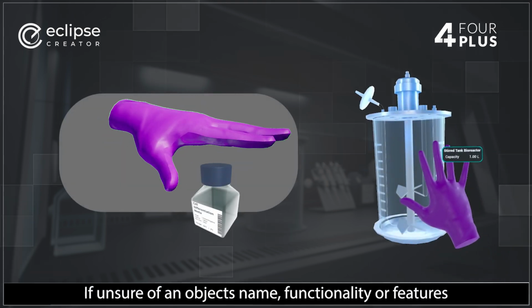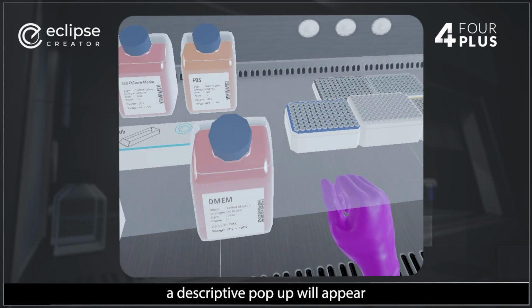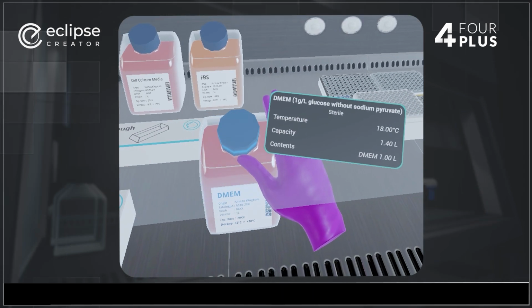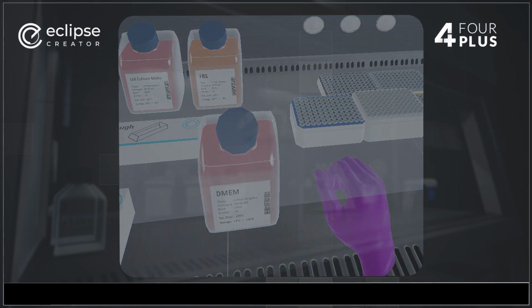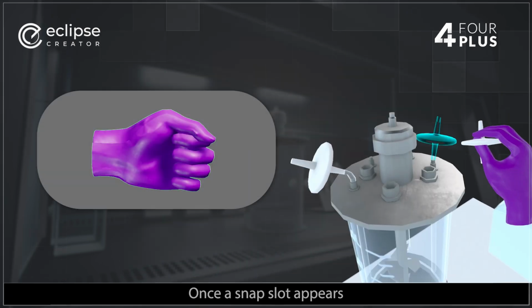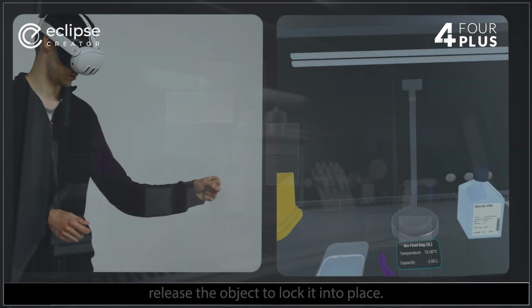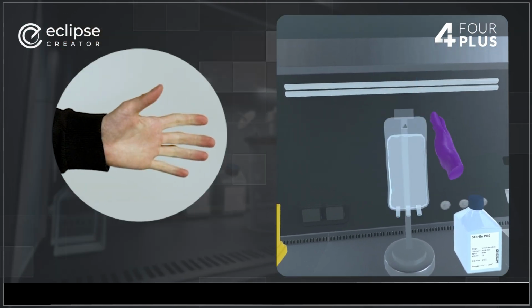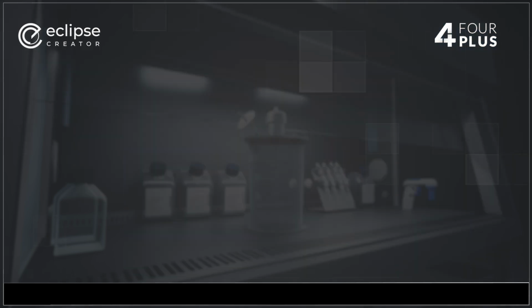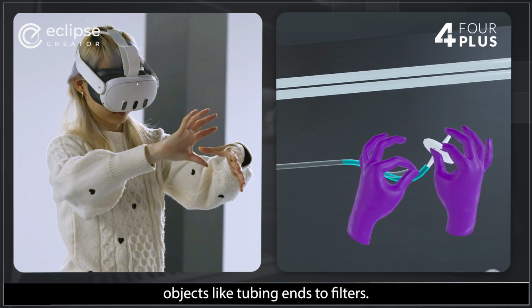If unsure of an object's name, functionality, or features, a descriptive pop-up will appear by hovering your hand over it. Once a snap slot appears, release the object to lock it into place. This technique can be used to connect objects like tubing ends to filters.